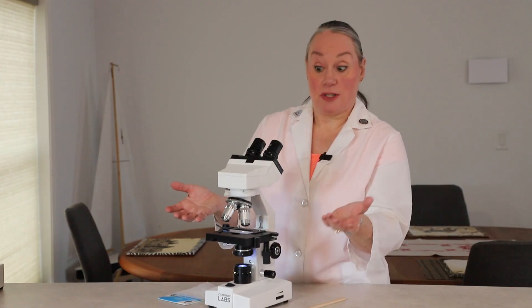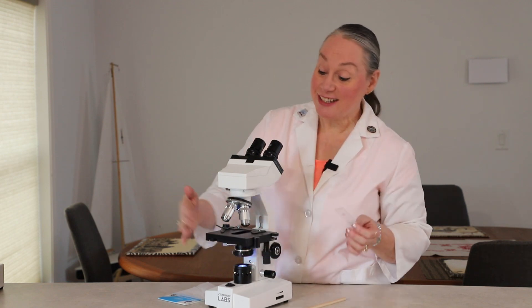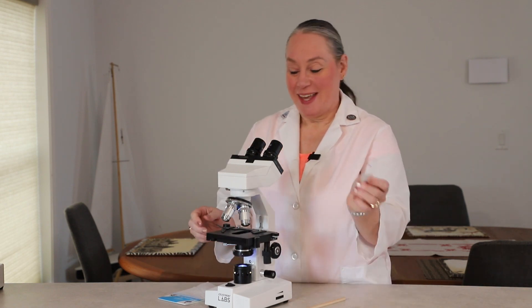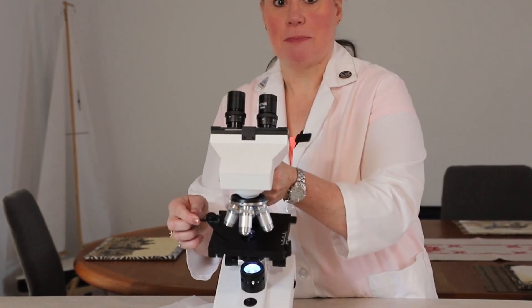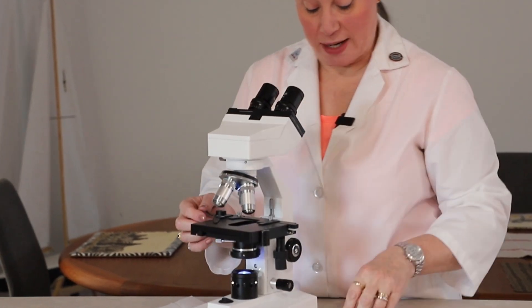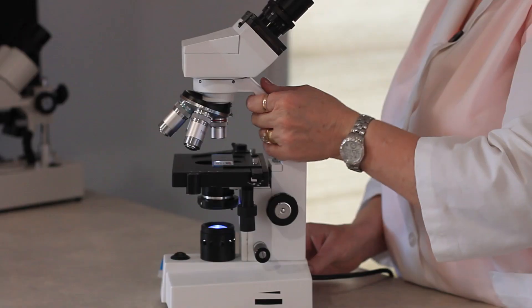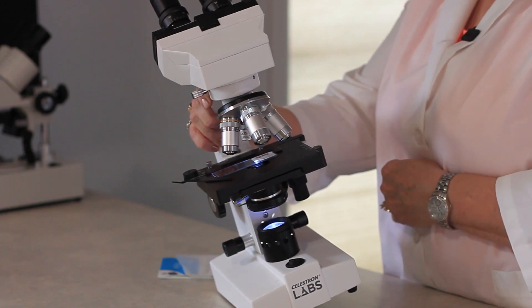In order to actually see a specimen, you've got to have one on the stage, and the stage is this piece right here. It is where the show happens, and we have an amazing clip on this microscope. There's just one, and it will clip the slide into place — so you can see that my slide is on the stage, it's clipped in.